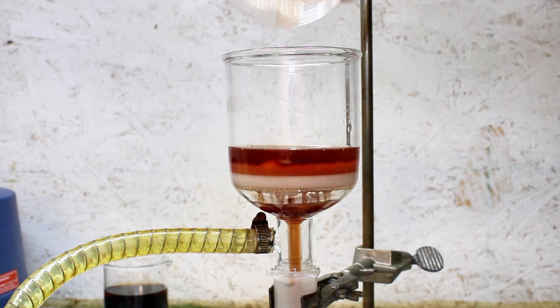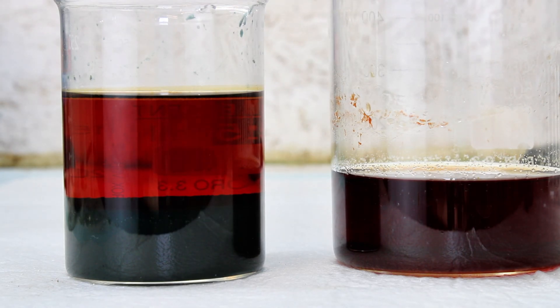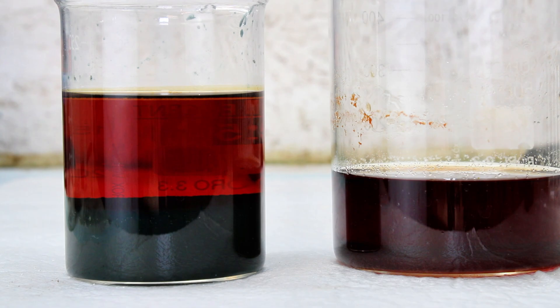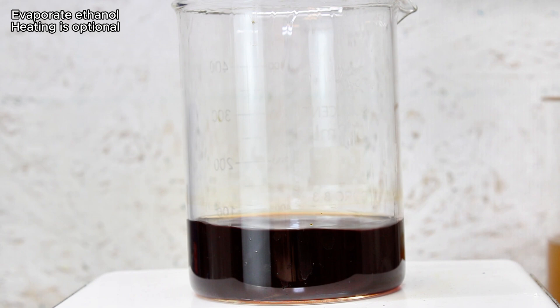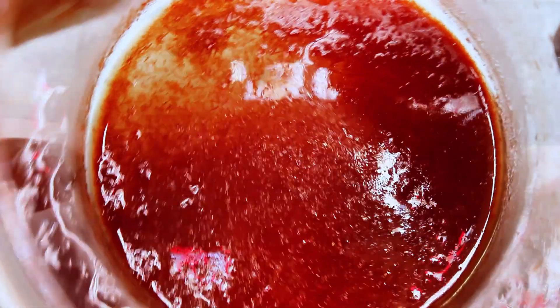As you can see here, by the way, I was indeed able to extract some more sodium nitroprusside from the super crude stuff from earlier, but I didn't think it was worth purifying, so I just decanted it off and left it as an impure solution. Once most of the liquid had been boiled off, pure crystals of sodium nitroprusside form, which I collect by another vacuum filtration.